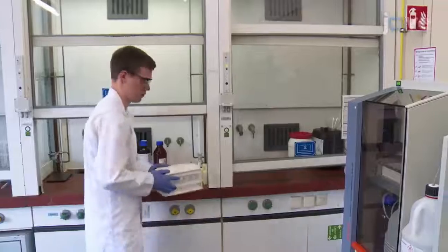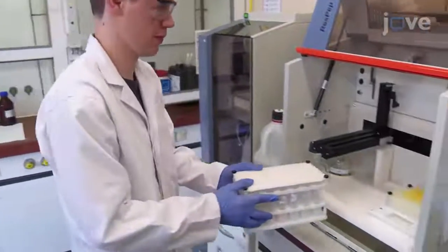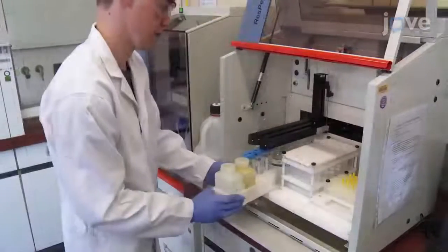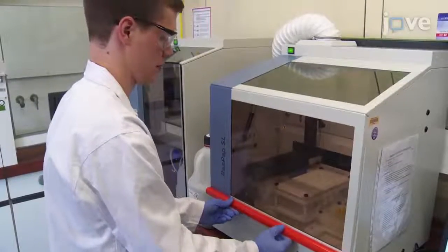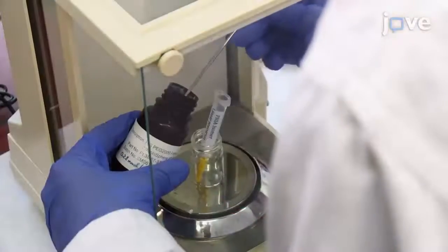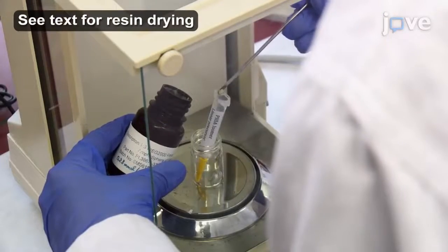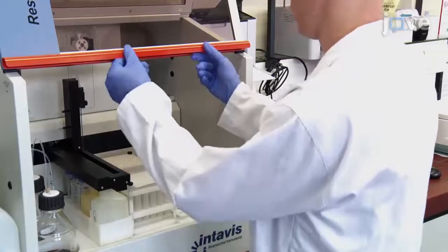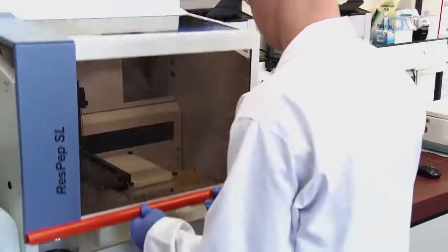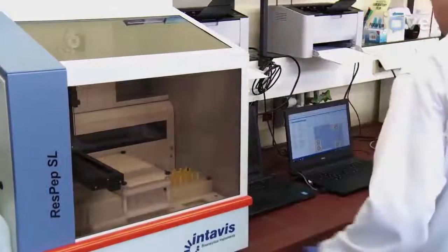Transfer the reagents listed in the text protocol to the corresponding vessels and place them in the appropriate racks of the solid-phase peptide synthesizer. Then, add 100 milligrams of dry resin to the reaction columns and put them in the rack of the synthesizer. Start the solid-phase peptide synthesis as detailed in the text protocol.